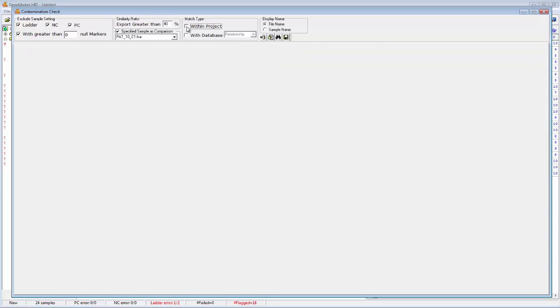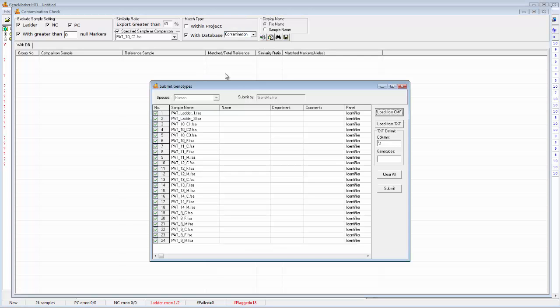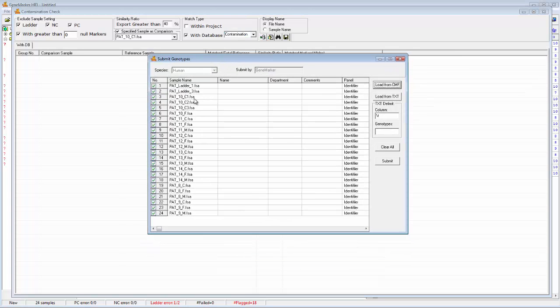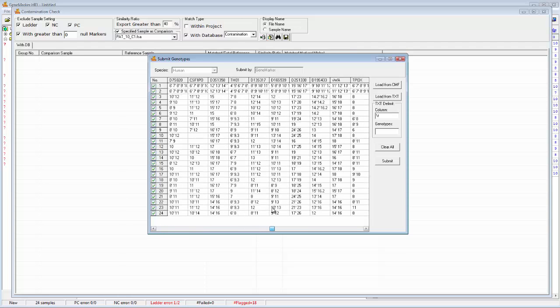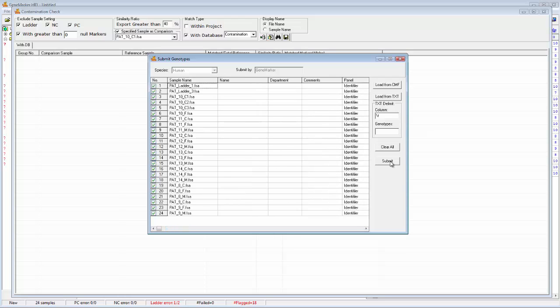So this time I'm going to change again, and I'm going to search within a database. I'm going to search within the contamination database. Now, a little bit about the contamination database. You can submit samples to the contamination database by clicking this submit icon. And when you do that, you'll see all the samples in your current project. If you scroll over to the right, you will see their genotypes. And you can submit those samples to the database just by clicking on the submit icon.